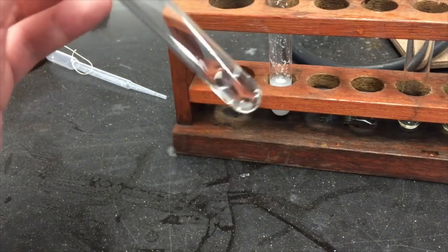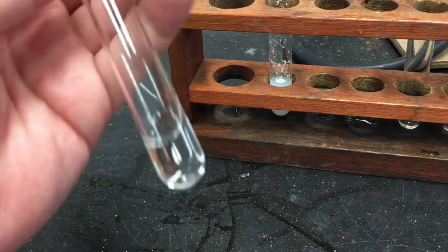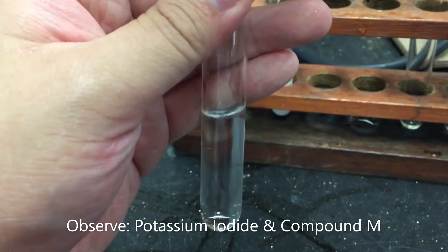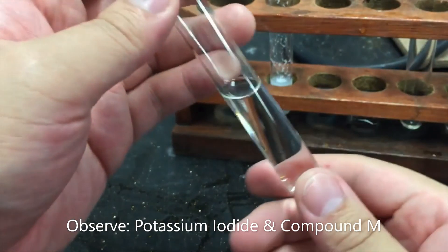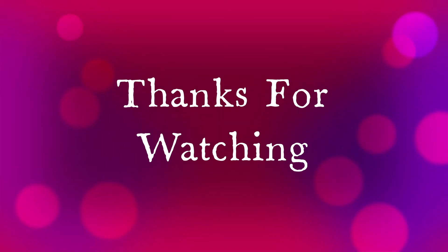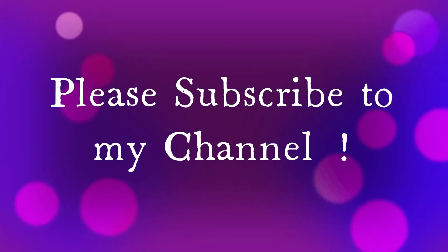To test tube E, we're going to add a solution of potassium iodide to compound M. Thank you guys for watching and all the best with your examinations.